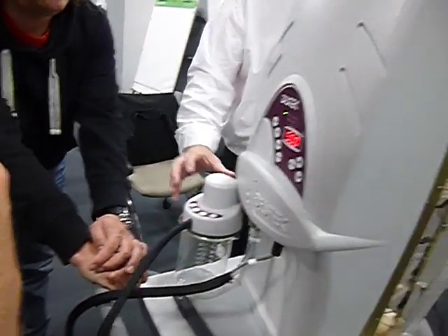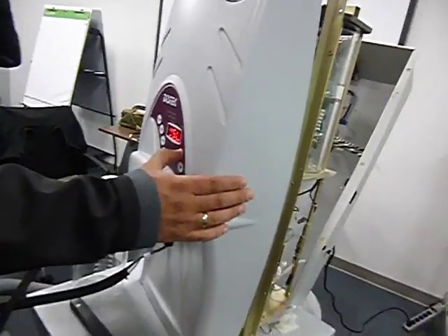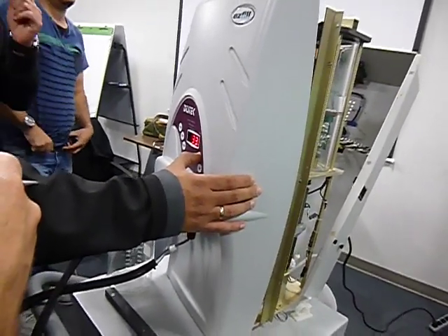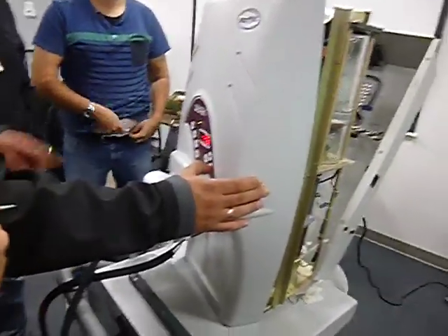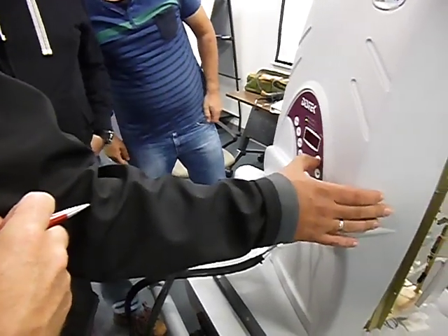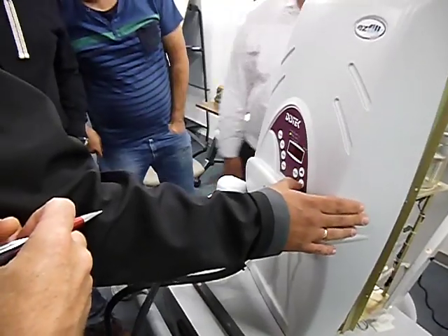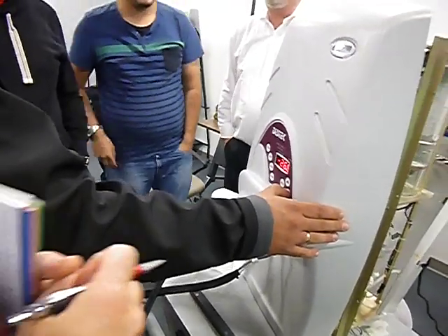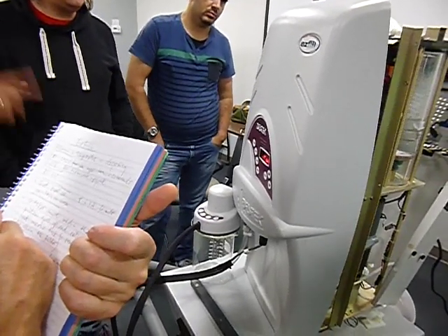All right. What's the spec on the temperature? 37. 37 plus or minus how many degrees? 2 degrees. All right. You see here the vacuum. You have to push only the arrow, not the setup arrow. Yeah, it's been a while. And if you hit the bottom, it's temperature. One is temperature, one is pressure.